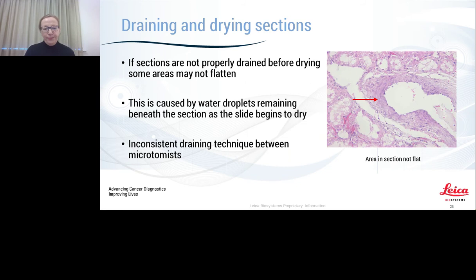So, draining and drying sections. Very important. If they're not drained properly before drying, some areas may not flatten, because there are water droplets that remain underneath the section. You can see that it's actually lifted, but it may look like there is something missing in the morphology, and you may not be able to make a diagnosis at that point because there's still some water that has caused this lifting. You often get inconsistent draining techniques between microtomists, or sometimes, in a rush to get slides into the stainer, they're just not left long enough. So it is a really important point to make sure that there's standardisation here.